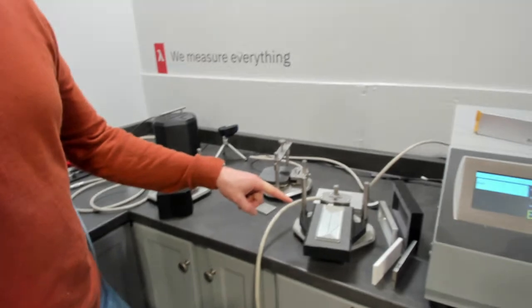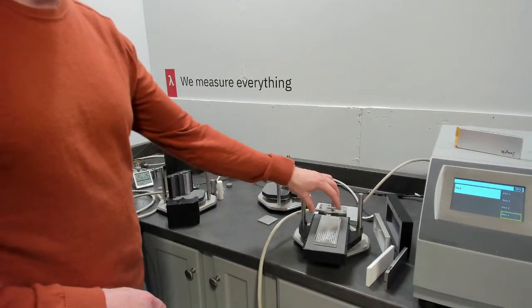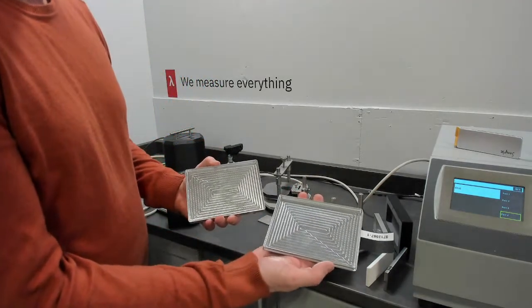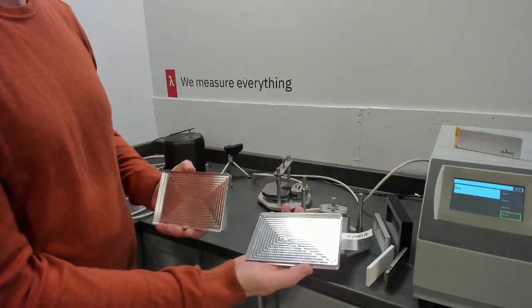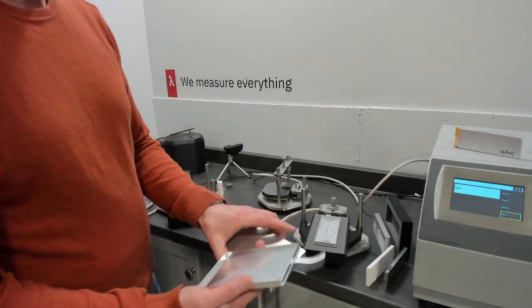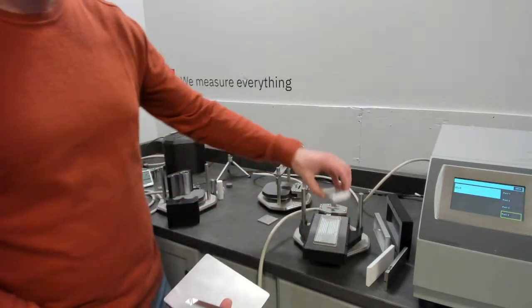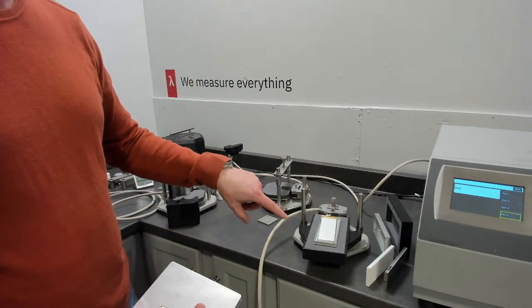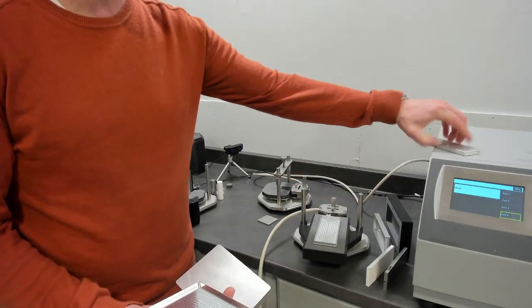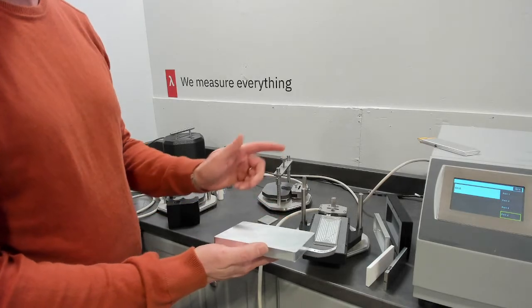So here is set up a particular specific heat cell of 1 dimension. As you can see, we have a range of dimensions. This one is about 95 millimeters wide, and we can custom make these. These are 2 standard sizes. The pouch battery that we're going to test today, that we've already measured specific heat on, you can see fits inside the cell. And the point there is we want to measure that entire sample for specific heat. And this one's just twice the width, and that's for pouches that vary in size.